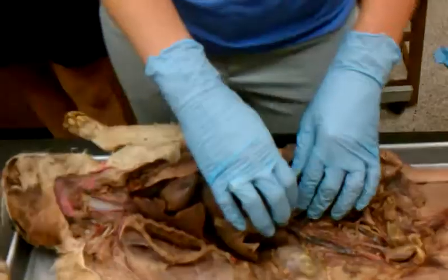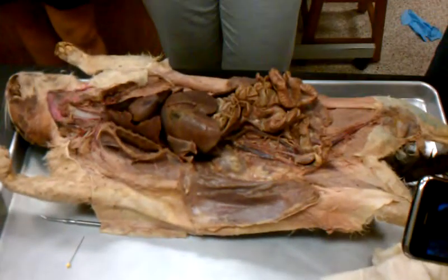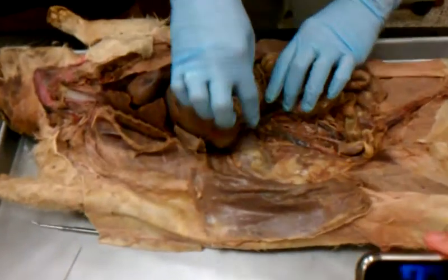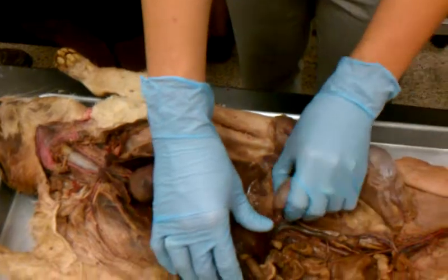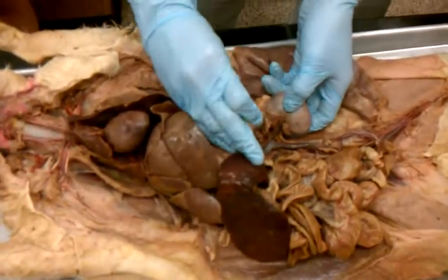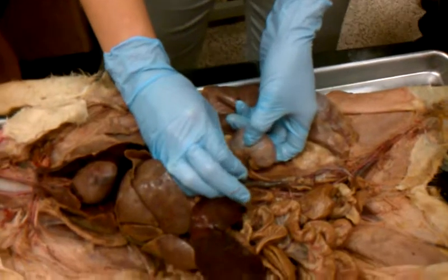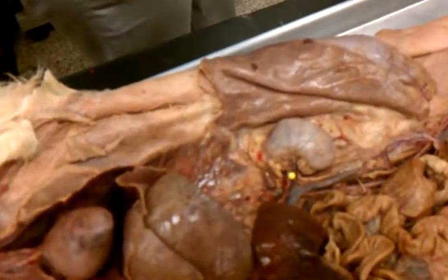Then we have, okay, your renal. Does anyone know what renal means? Kidney. So when you think about the kidneys, think about the word renal. So if I pin one, these big old things are kidneys. You have one here. You have one right here. Looks like this is the one that we dissected on this cat. So if I pin this that's going right to it, that's the renal artery. And on this cat, it's the left renal artery.